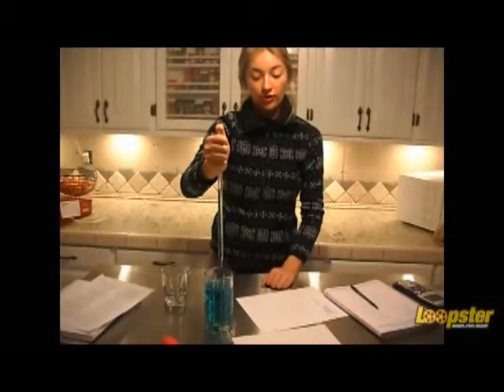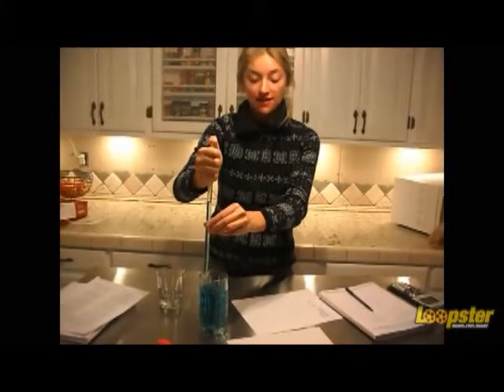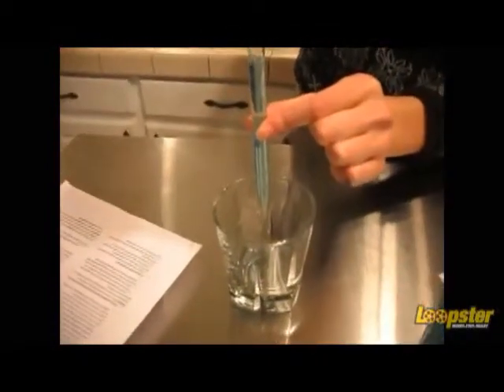Alright, now it's time to record your final volume by releasing the designated amount into your reaction vessel. So I'm going to release the solution.